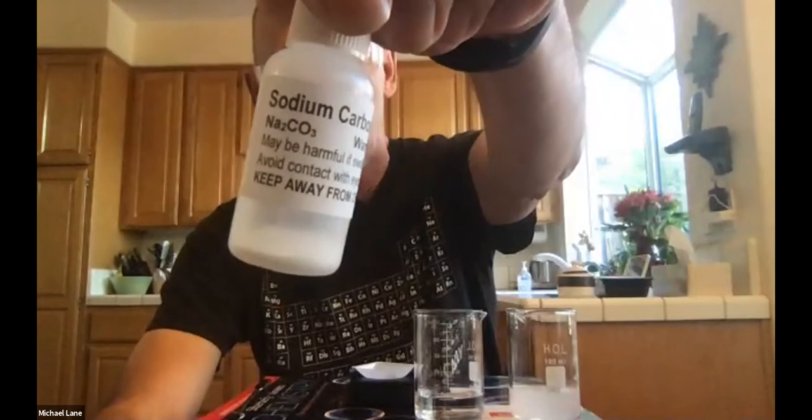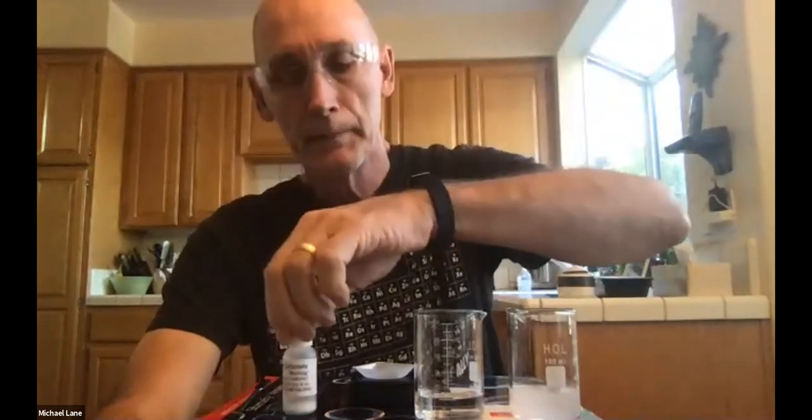And while we do that, I'm going to share screens again and go to a calculation, because we want to use the remaining material, sodium carbonate, such that the calcium chloride remains the limiting reagent. Well, we have to know how much sodium carbonate is necessary based on 1.47 grams. Now, I want to point out that you, of course, are going to have a value or an amount different than 1.47 grams.